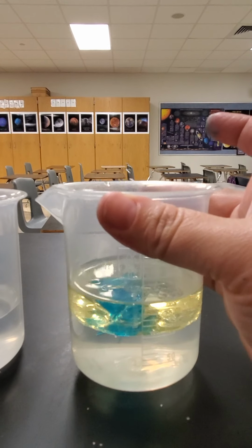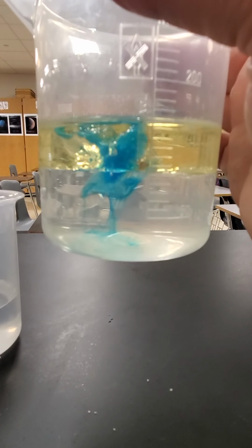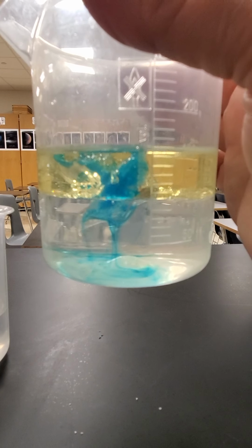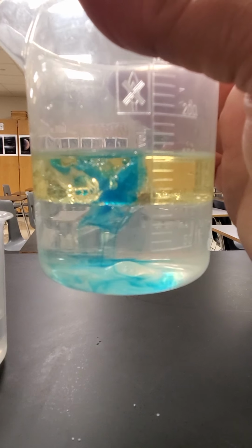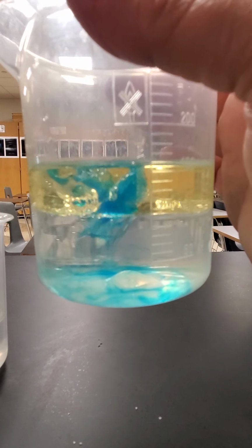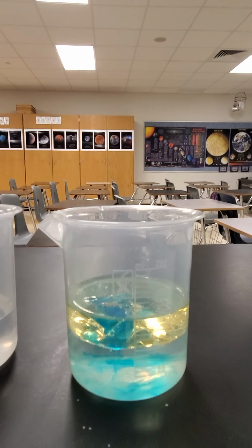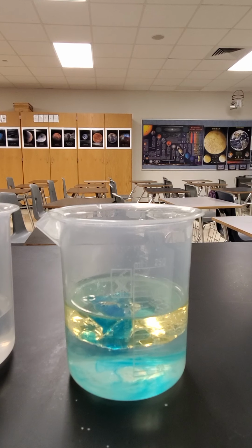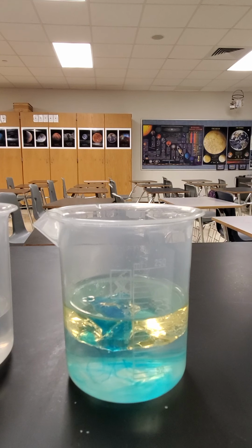Okay, and they say to watch it for a couple minutes, but oh, it's happening already. There we go. That's cool. Look at that. So what is going on? I'm sorry that my hand is shaking. All right, so there we go. My paper towel. Okay, so we're observing the ice as it starts to melt, and then you can answer the 3 questions at the bottom of the page.